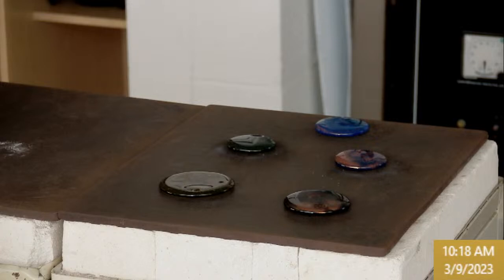In order to relieve that stress, you can go to a temperature that's not near melting, but it's above what's called the strain point or the annealing point of the glass. If we annealed these, it would release the stress from the glass that we're going to look at with this light table over here when we're done. This is the step where you'll notice I'm putting it into a different oven to anneal that glass, which stabilizes it from spontaneously cracking. So that's what we're about to see here.